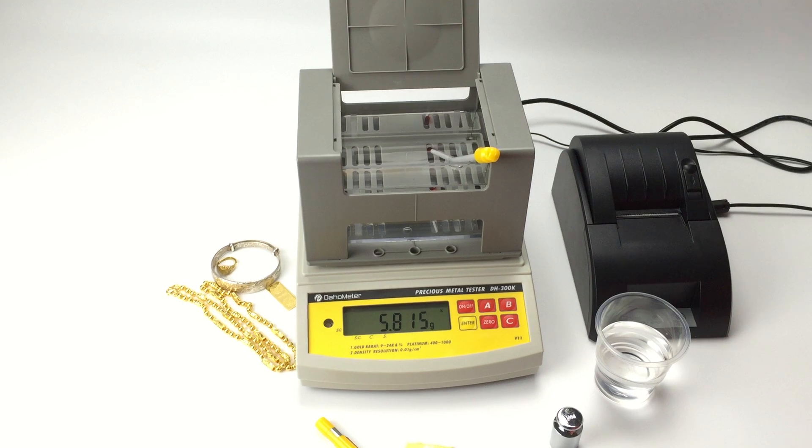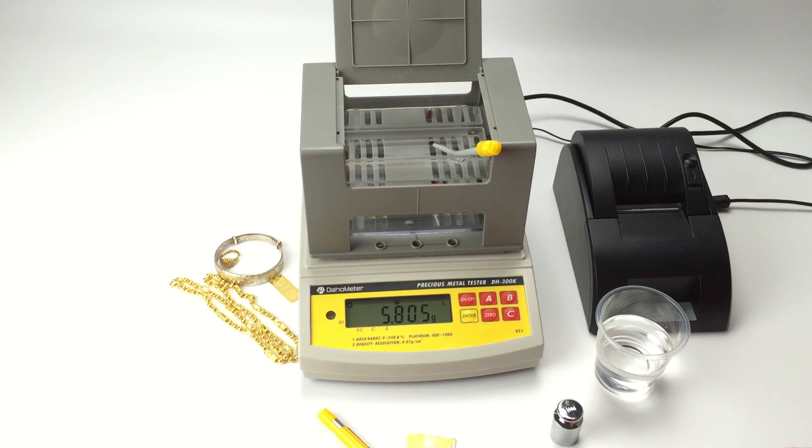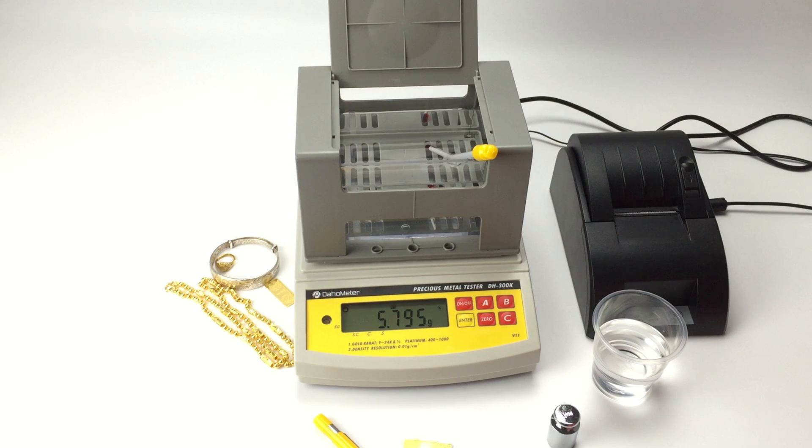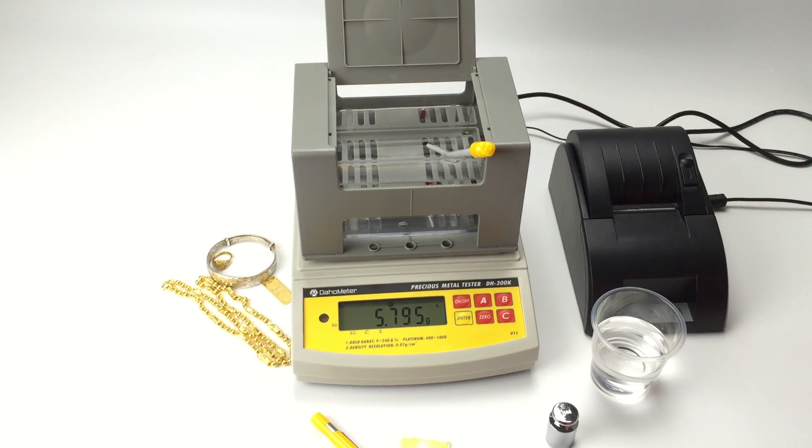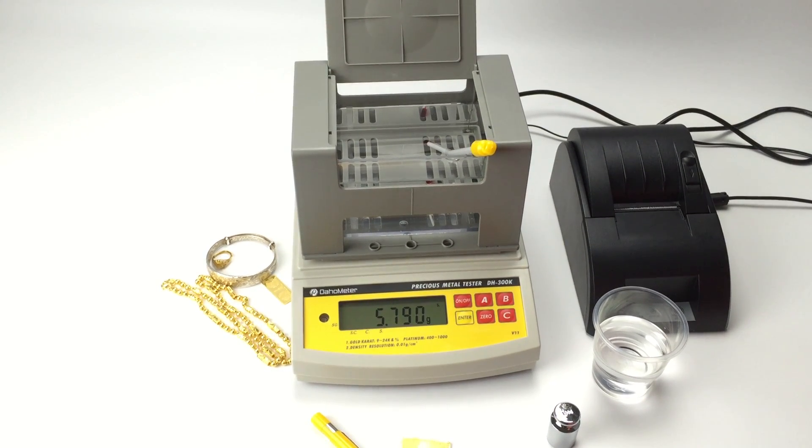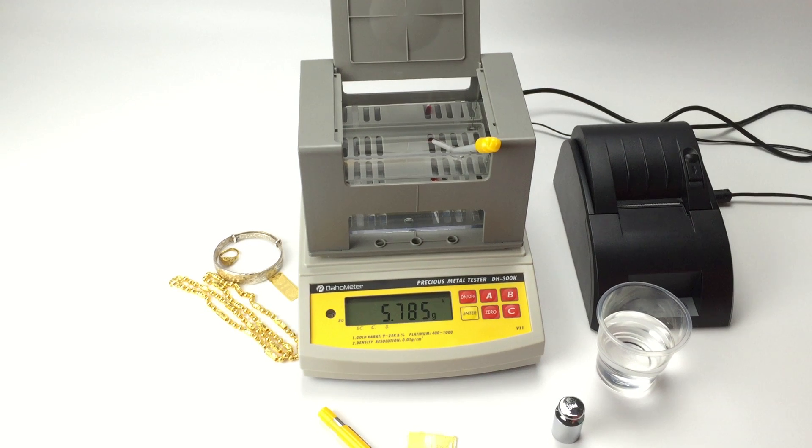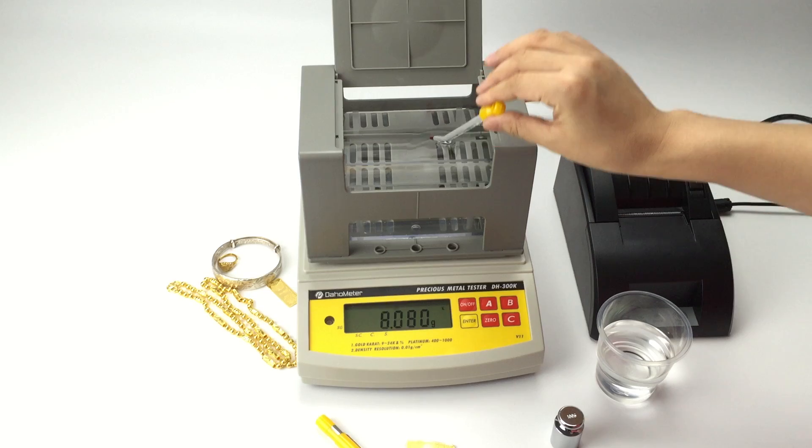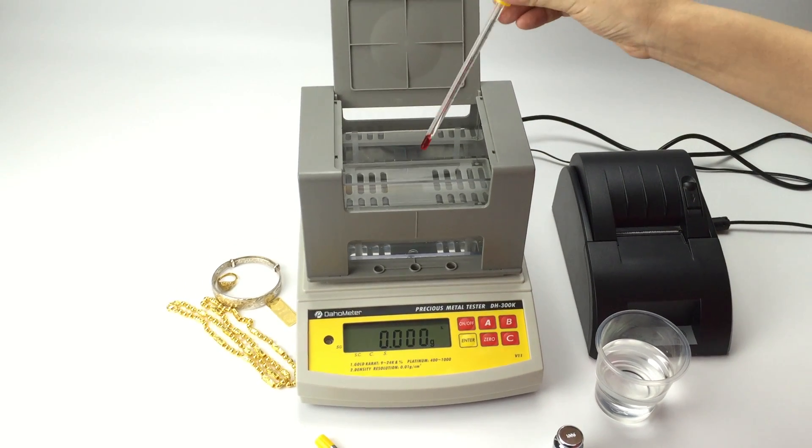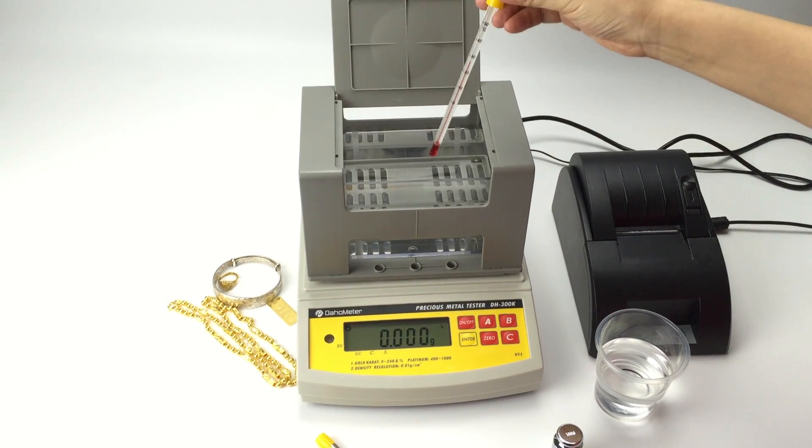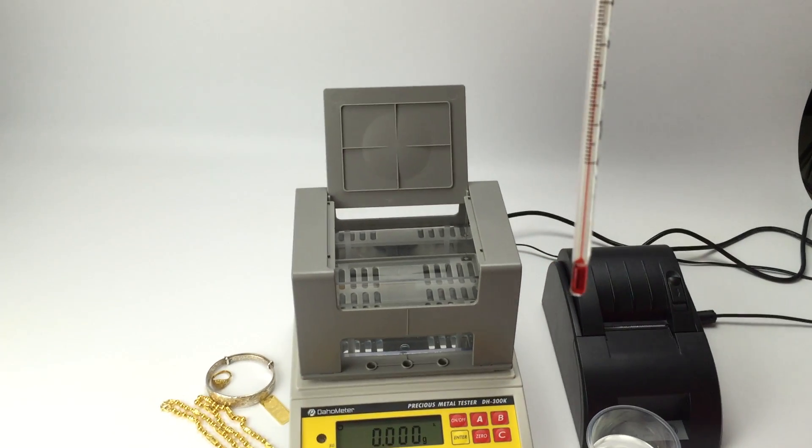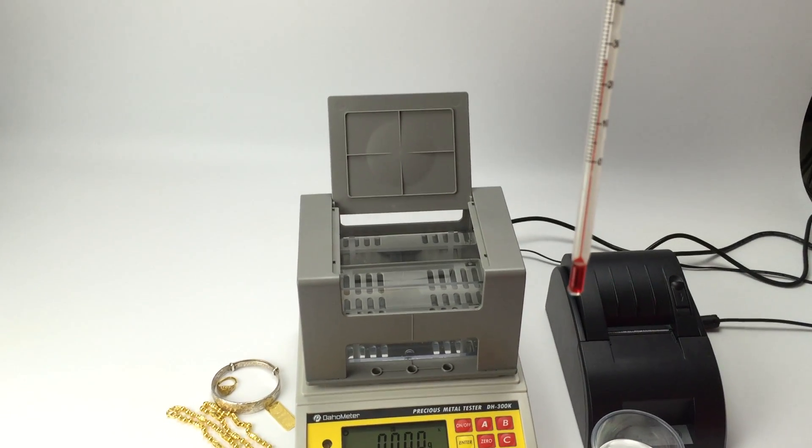It will take around 1 minute. Let's see the temperature. You can see it is 27.